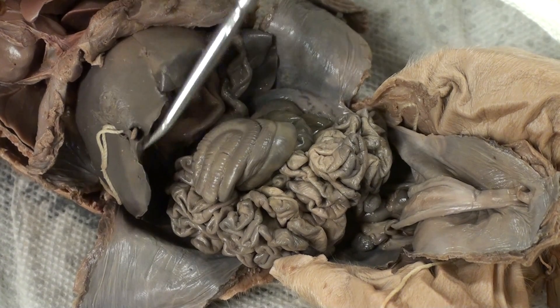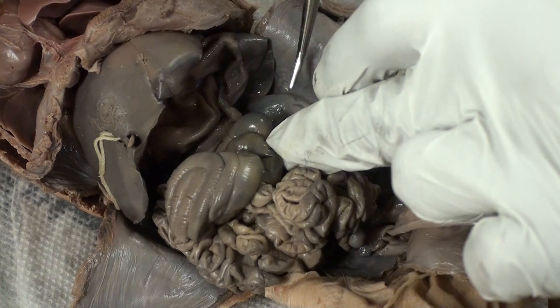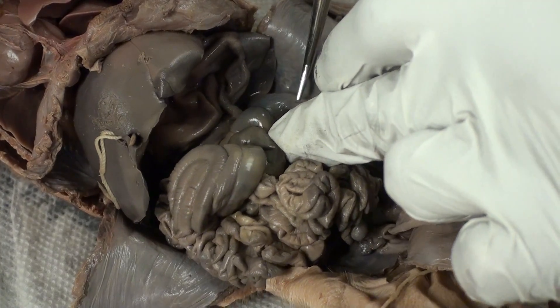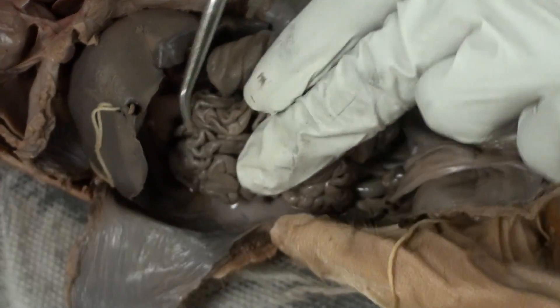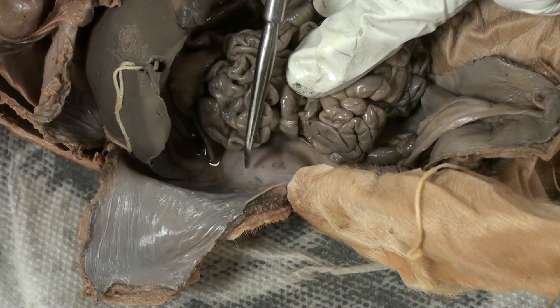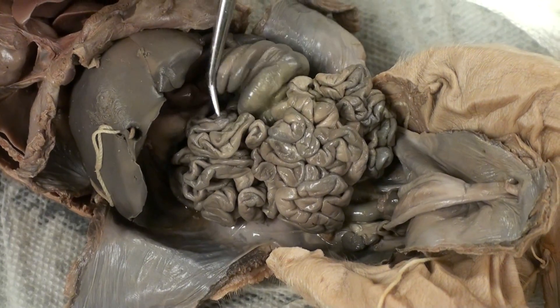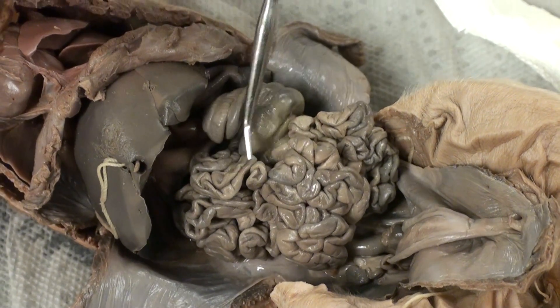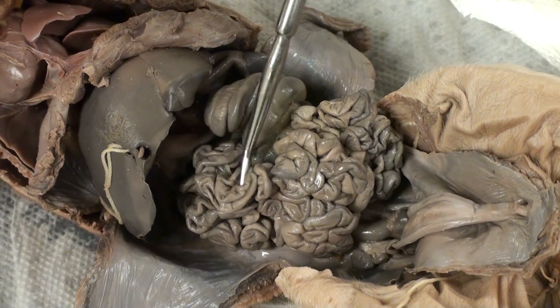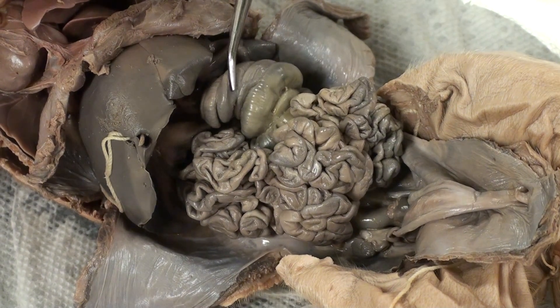Located down over here is the left kidney, and here is the right kidney. Located over here is the small intestine, and located here is the large intestine.